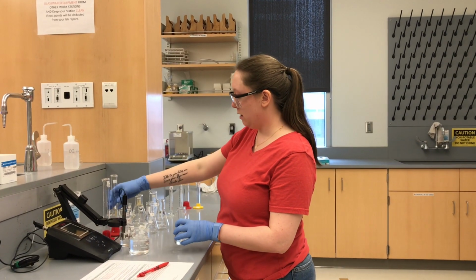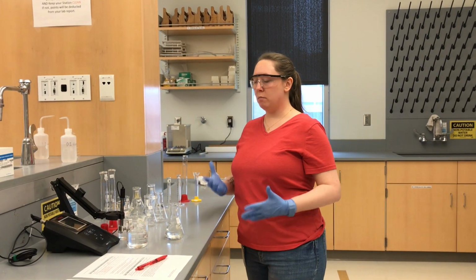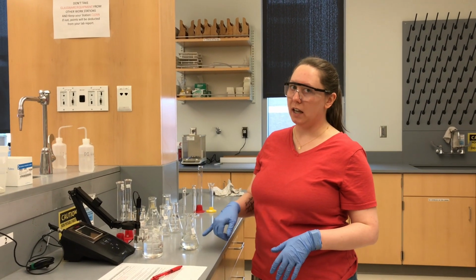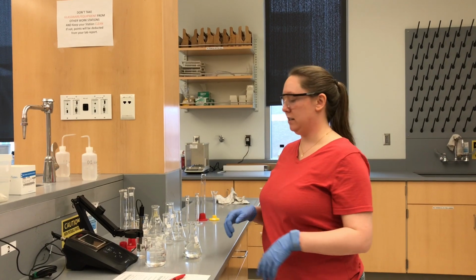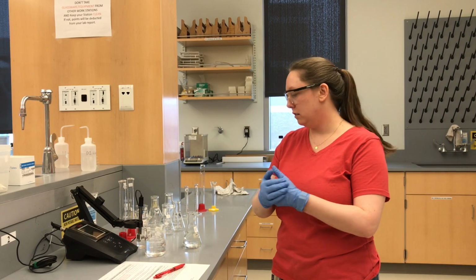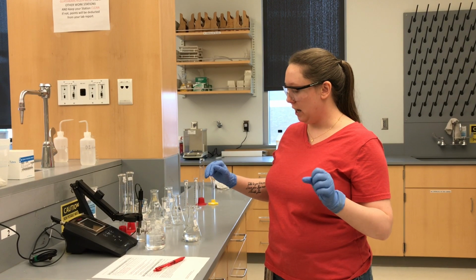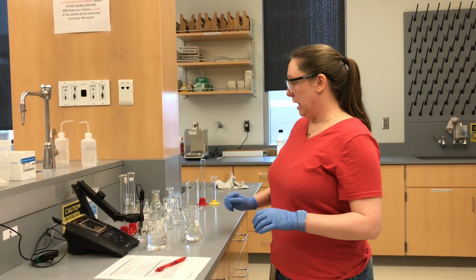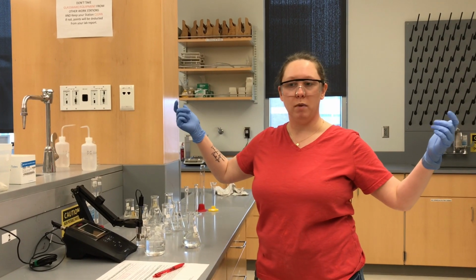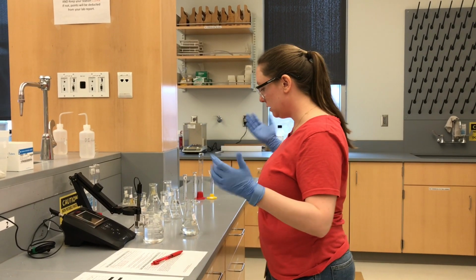All right, I want to make an observation. It smells like vinegar. So I'm going to assume that this might be acetic acid and sodium acetate. Okay, so we added HA plus Na plus A minus, so sodium acetate and acetic acid. All right, so hopefully at the end when we look up our experimental Ka, we'll find out that it's acetic acid.